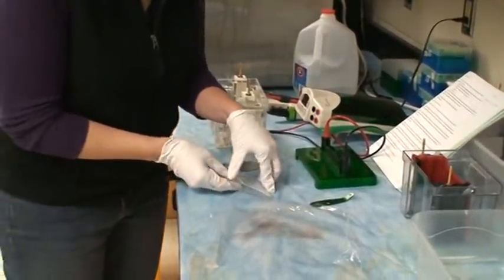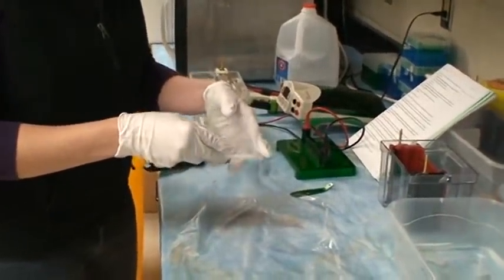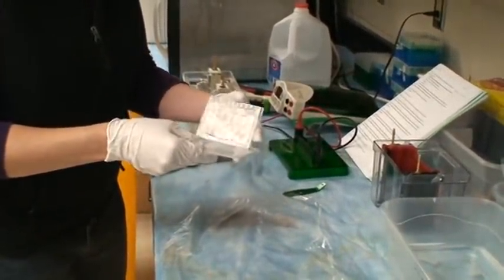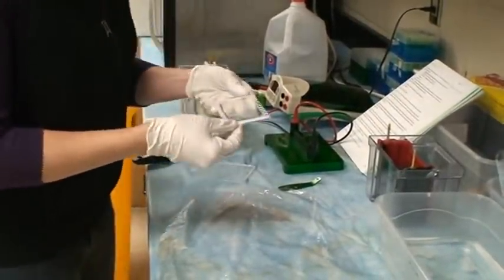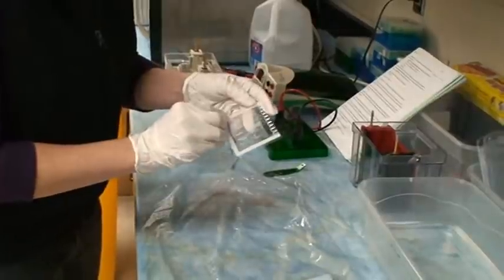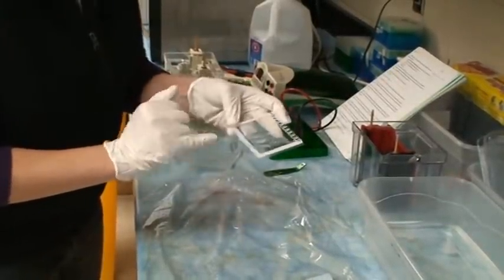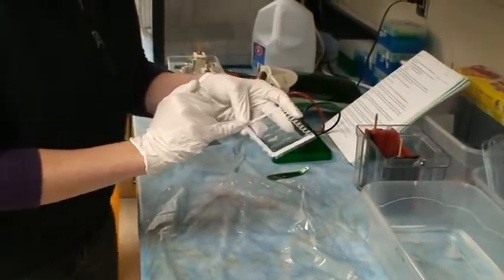You want to be careful. Your gel will stick to one of the two plates. Mine has stuck to the smaller plate. Once you get it separated, one of the corners of your gel will probably be sticking up a little bit.